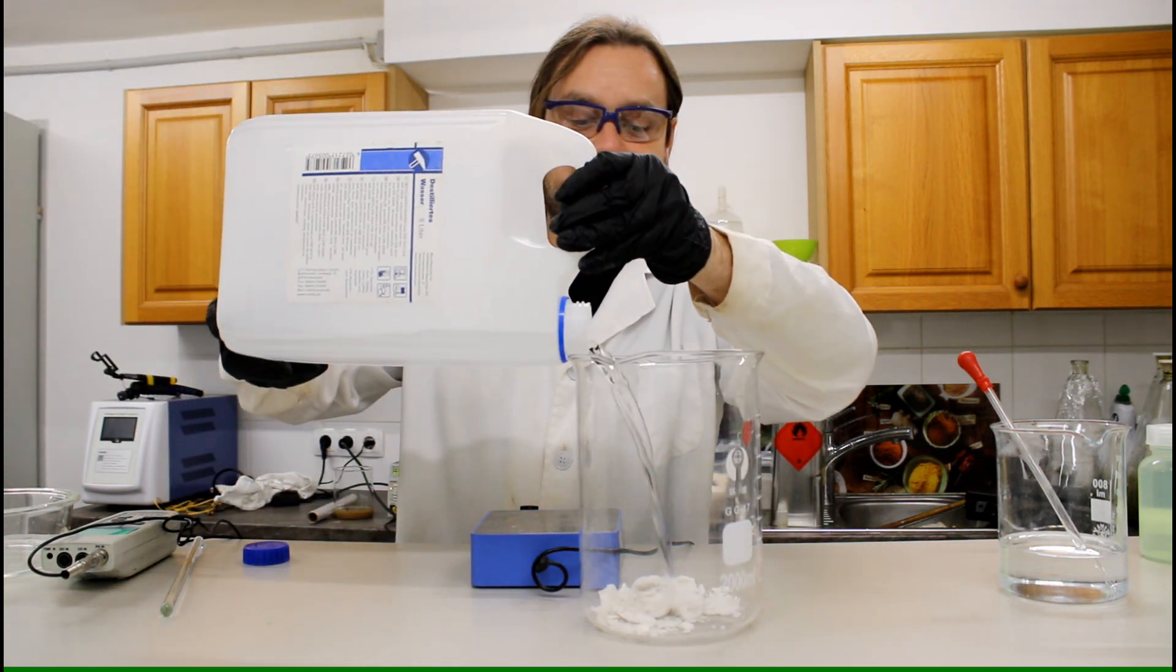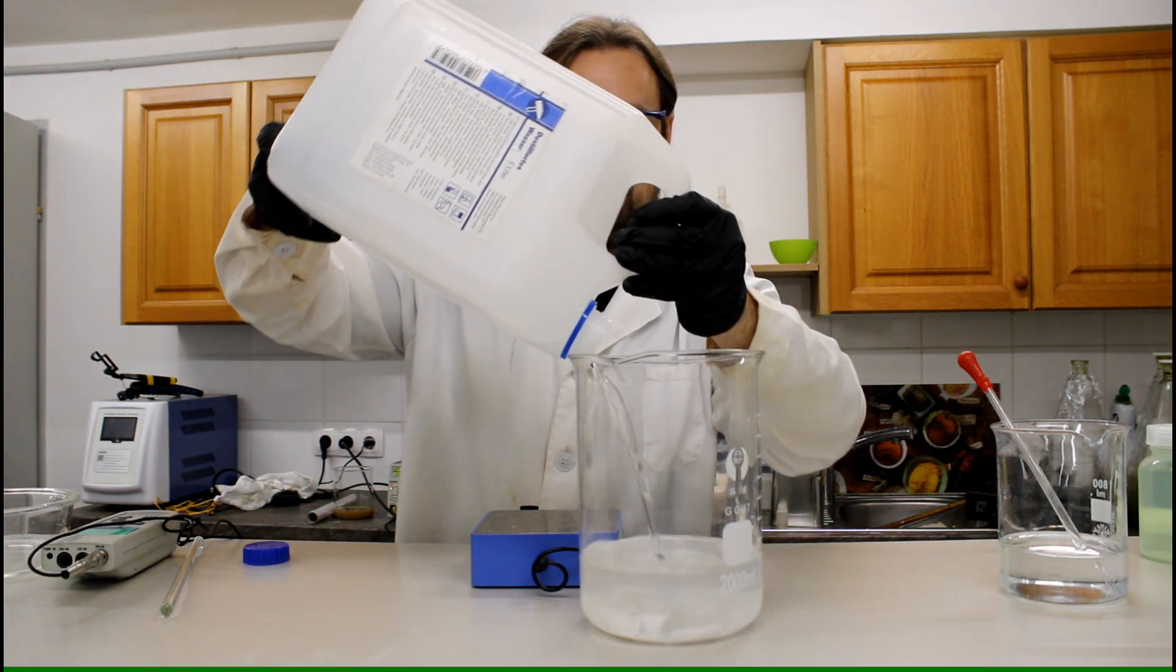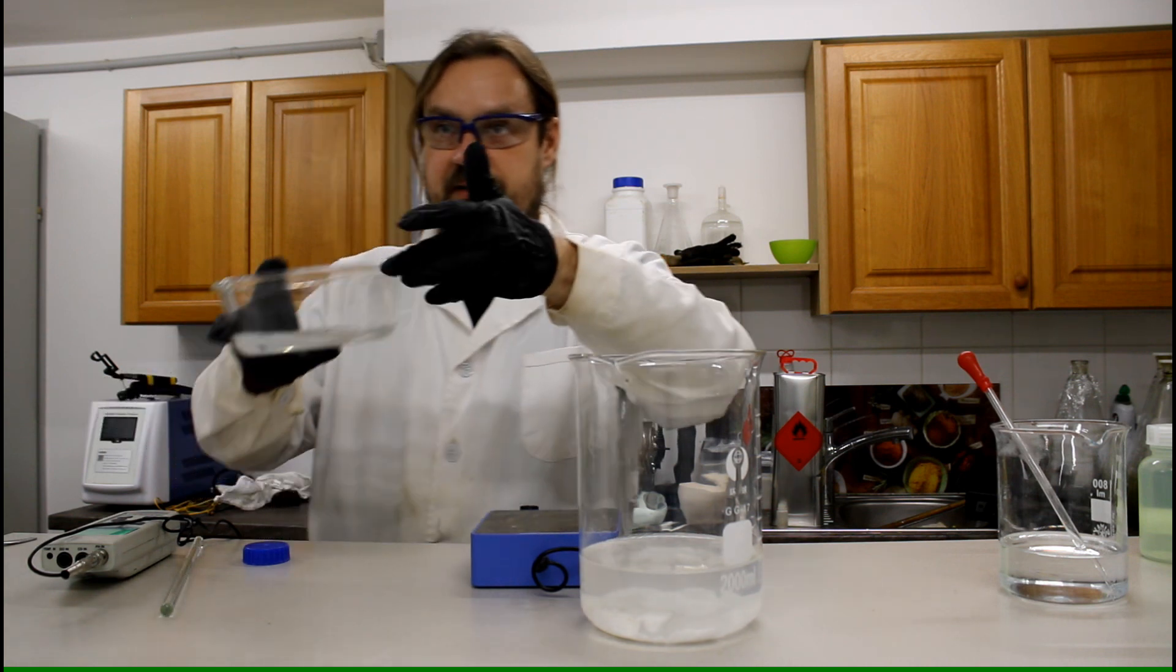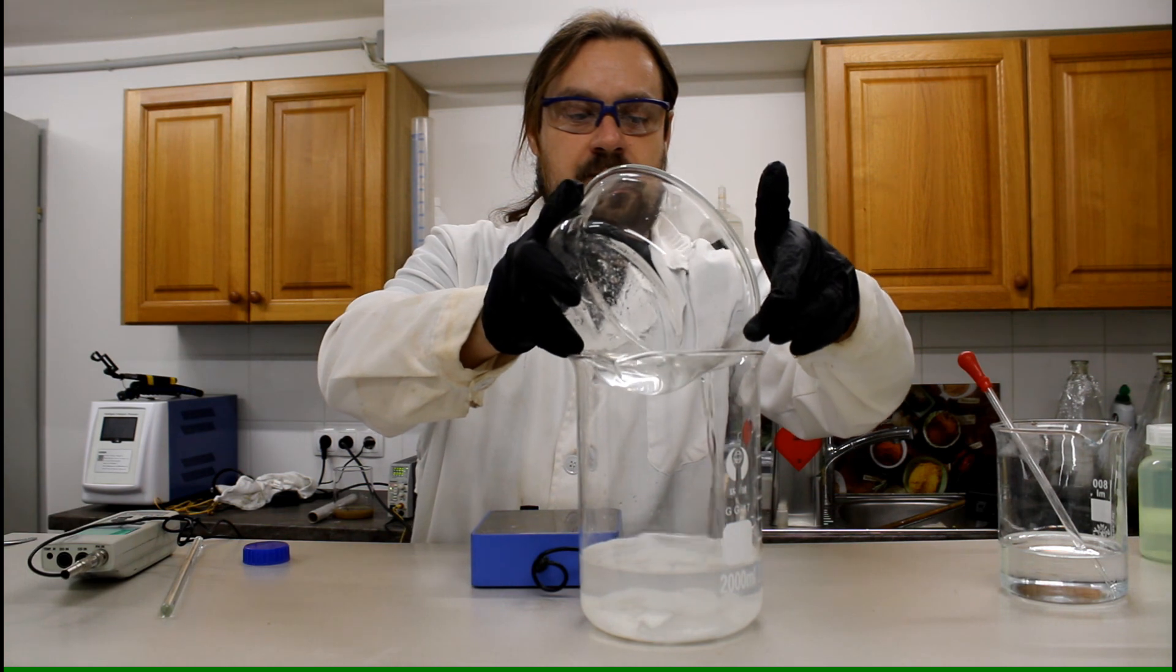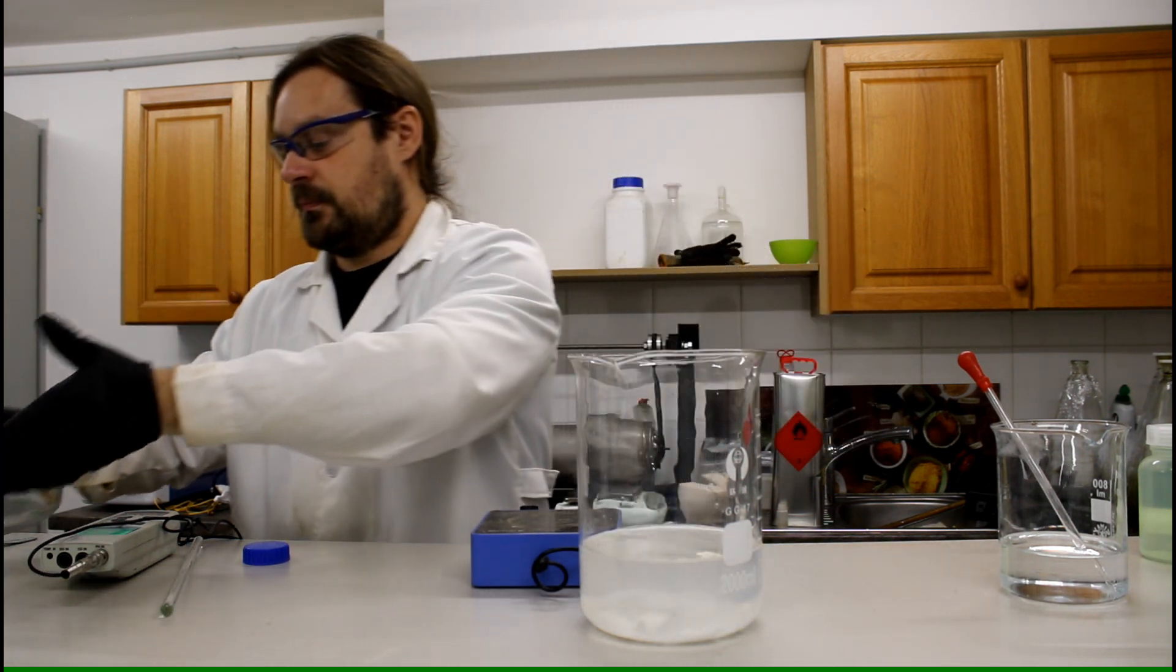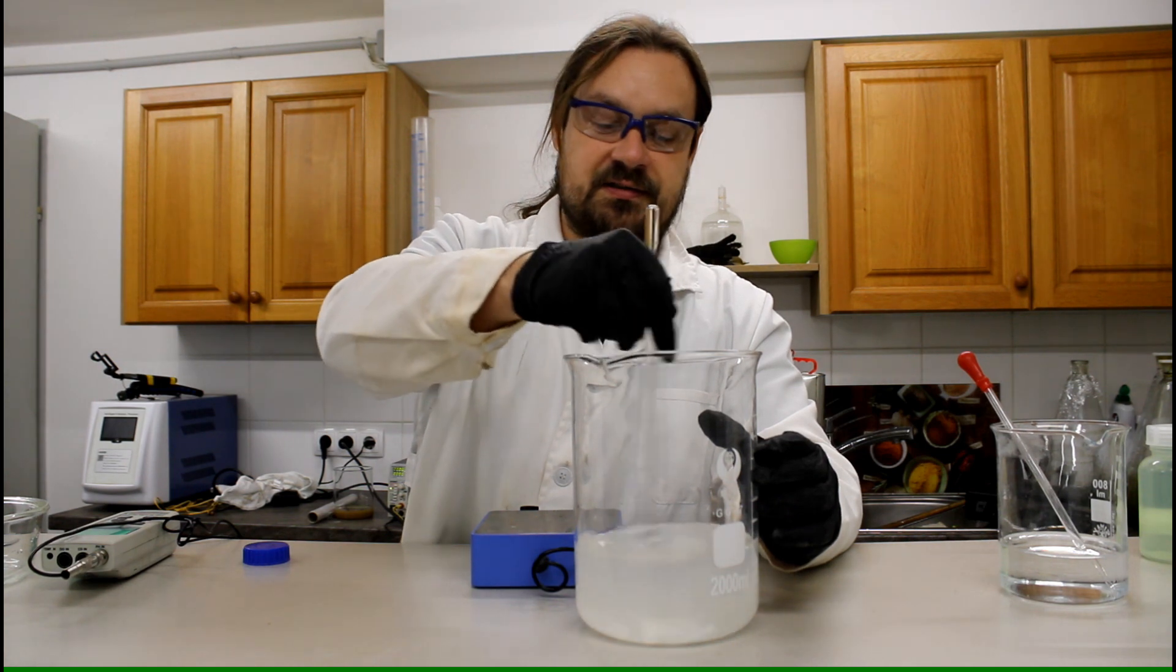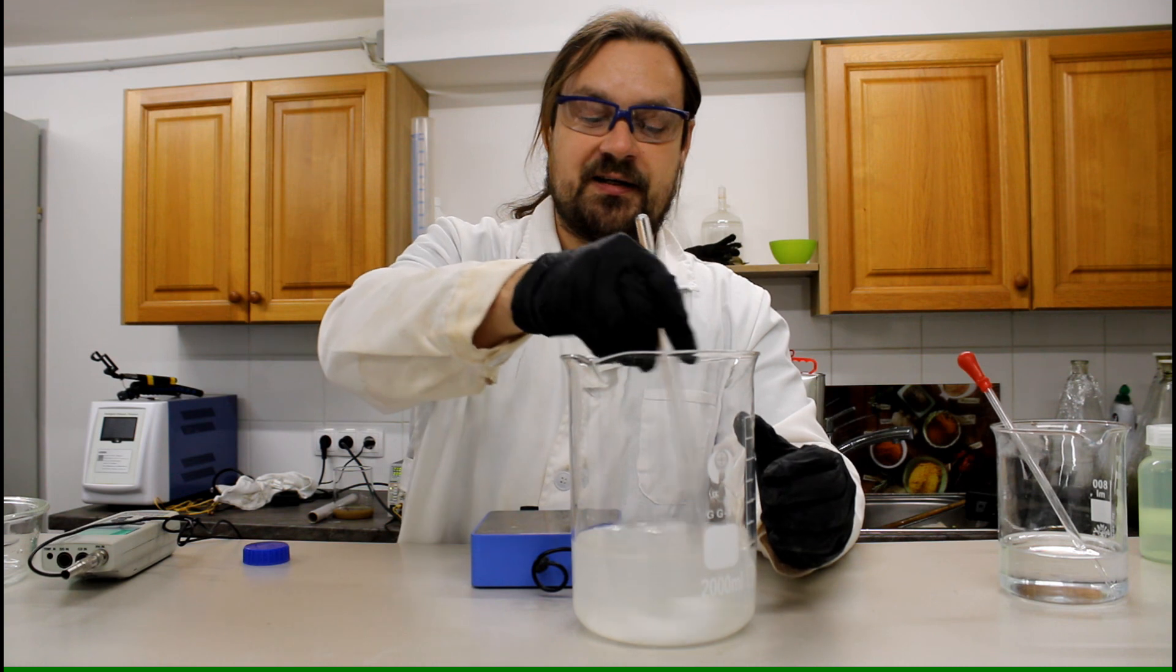So I am adding the distilled water. This is the wash water out of the bowl. And now we have to stir that stuff as long as it is completely dissolved. This could take a couple of minutes.